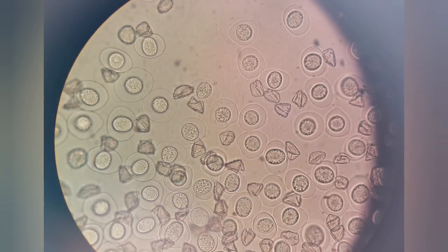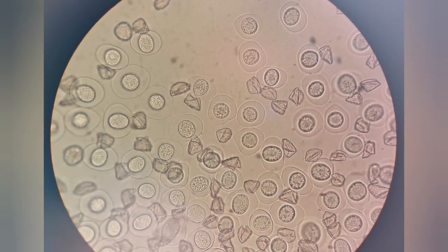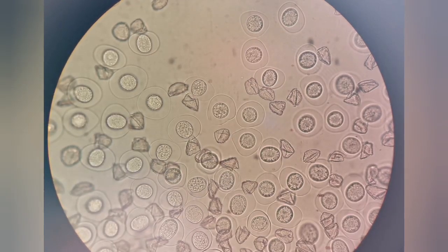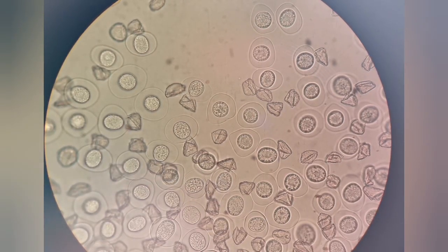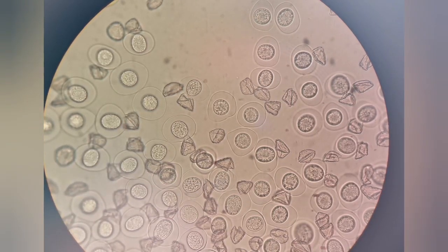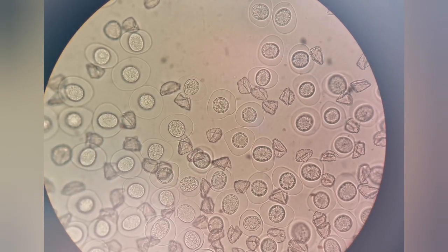It'll go a very long way. And that could last years, and the balsam should last years. Now this is the stuff we're looking at quantities of, but you can look at all sorts of things.